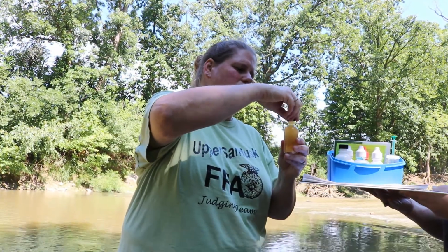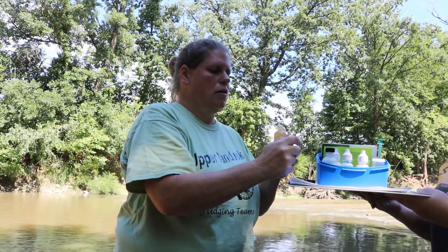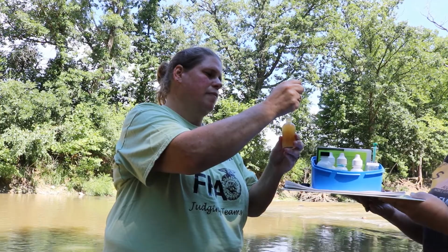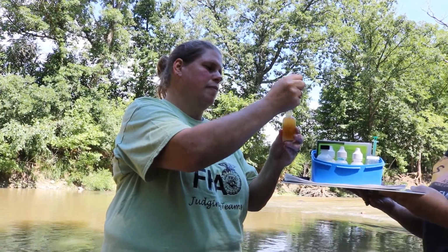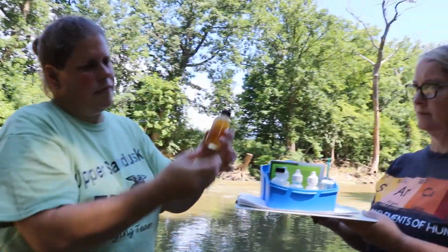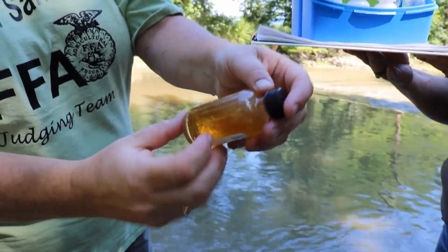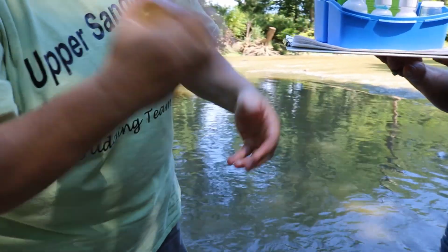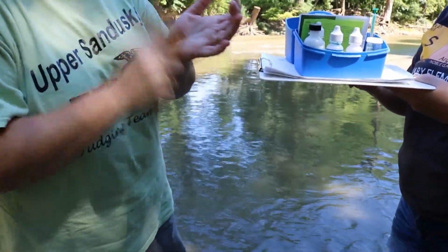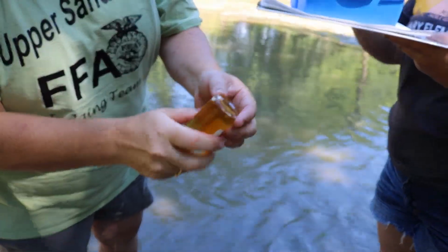Once it settles below the rim, we're now going to add some sulfuric acid to break it up. You see that's going to start to dissolve the precipitate. See, it's starting to look clear as it dissolves. And unfortunately we have to now shake this until all of that dissolves, which sometimes can take a really long time, because you end up with little brown floaties that also have to be dissolved.